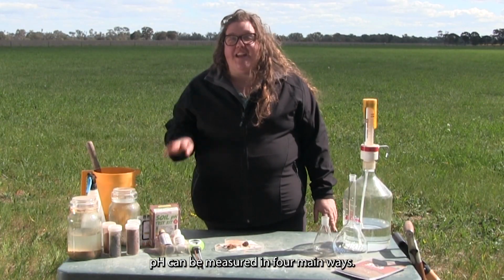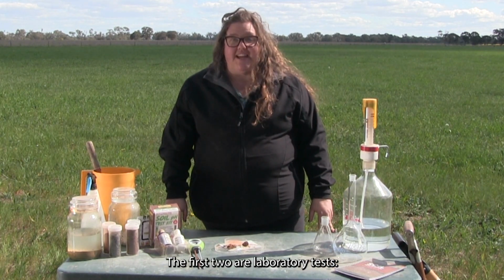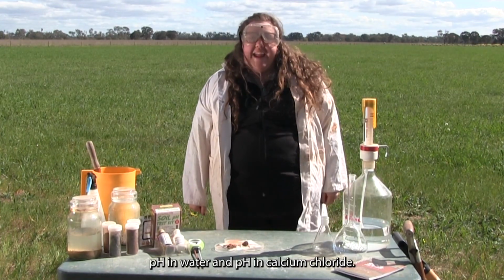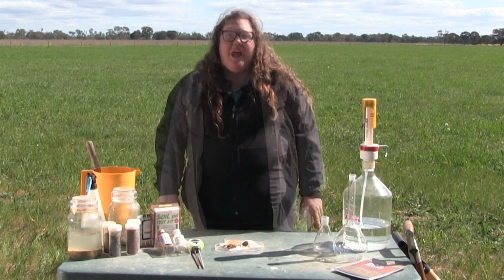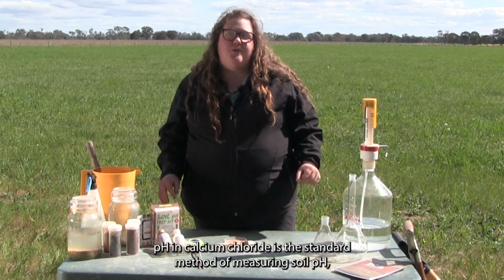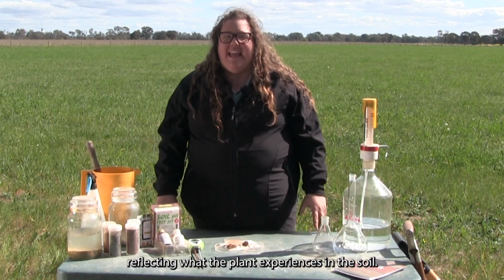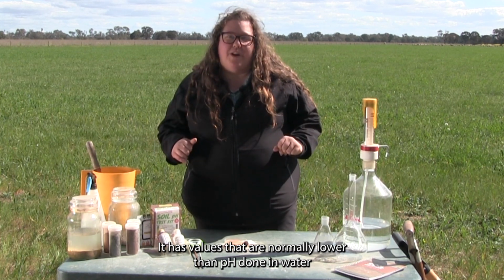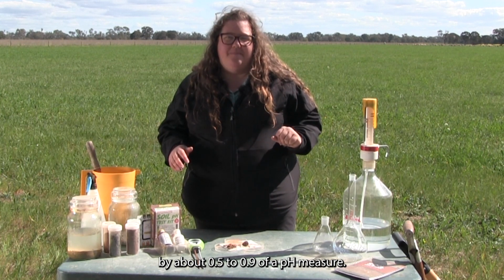pH can be measured in 4 main ways. The first 2 are laboratory tests: pH in water and pH in calcium chloride. pH in calcium chloride is the standard method of measuring soil pH, reflecting what the plant experiences in the soil. It has values that are normally lower than pH done in water, by about 0.5 to 0.9 of a pH measure.